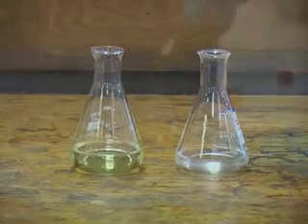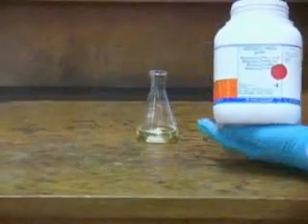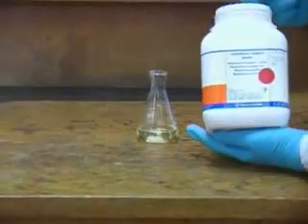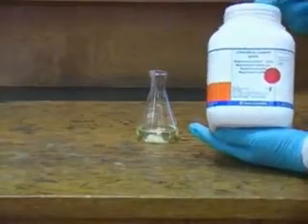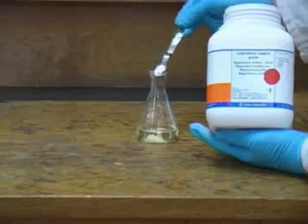In this case however we are simply going to dry the organic layer using magnesium sulphate. Other drying agents that may be used could include calcium chloride and sodium sulphate so make sure you read the script before proceeding. If the drying agent forms clumps as shown here that's a sign that the solution is still wet and that more drying agent is required.